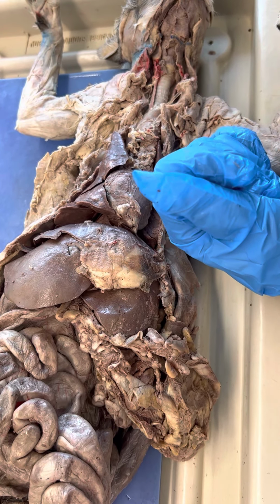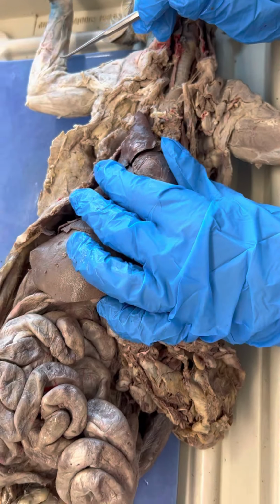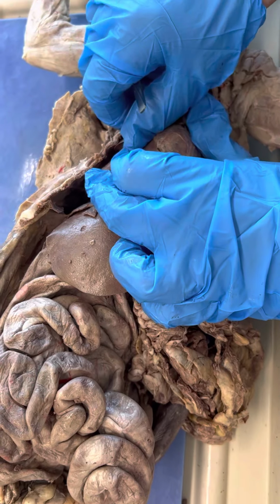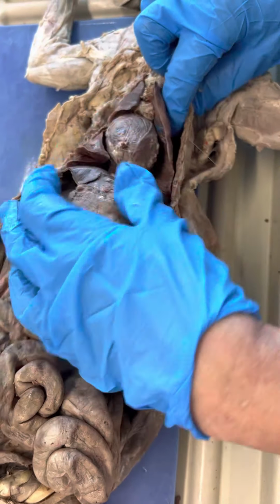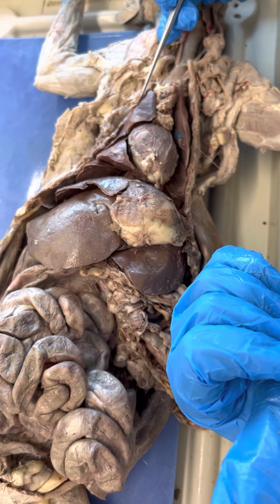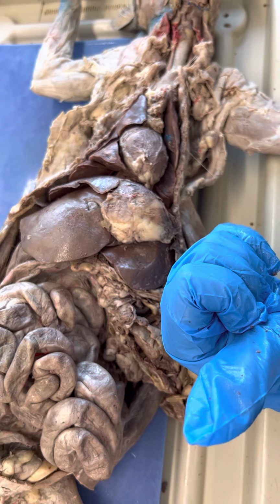I can't see the vocal cords on here. Lungs, I should be able to see the lobes. I should be able to see superior, I should be able to see in the middle, and I should be able to see the inferior. And I think if I were answering this and I wasn't sure, I would distinguish whether it's right or left. They don't say it on here, but I would distinguish right or left.